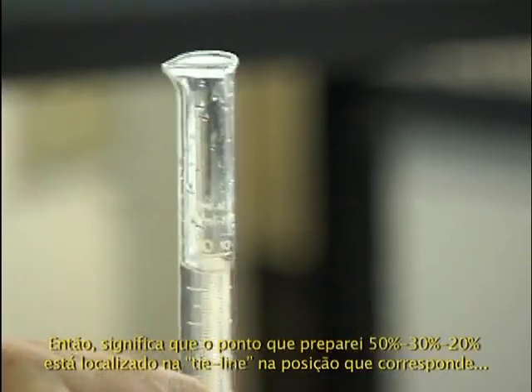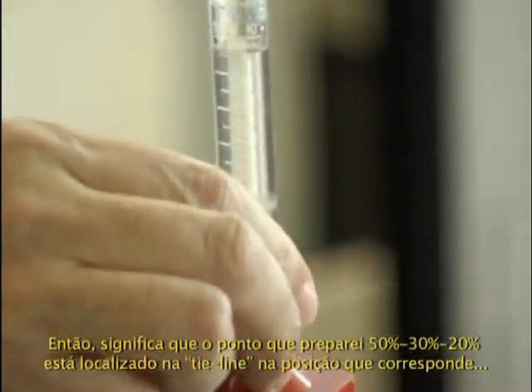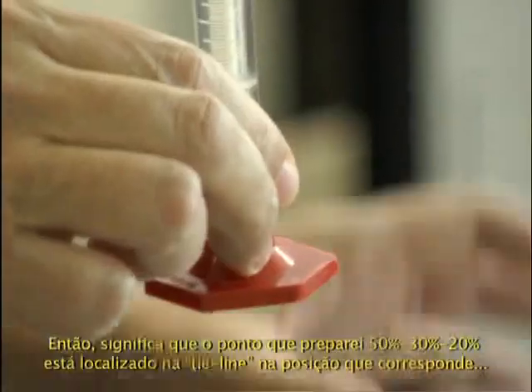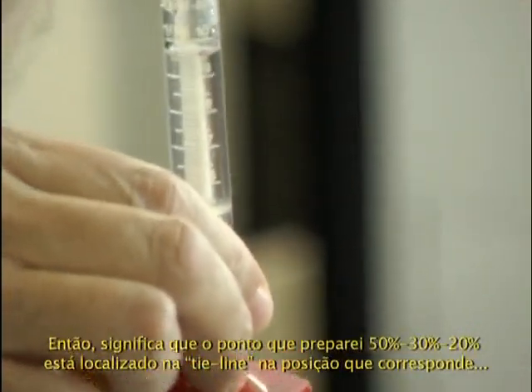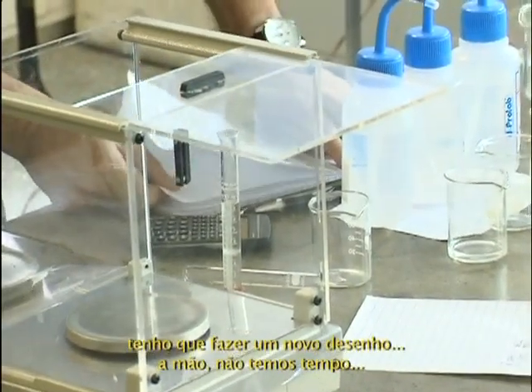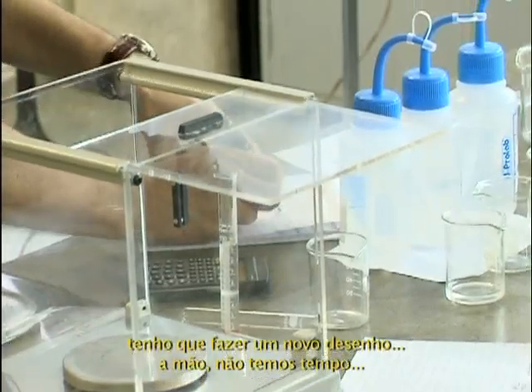So it means the point I prepared, 50%, 30%, 20%, is located in the tie line at a position which corresponds to... I should make a new drawing. By hand, we have no time, okay?